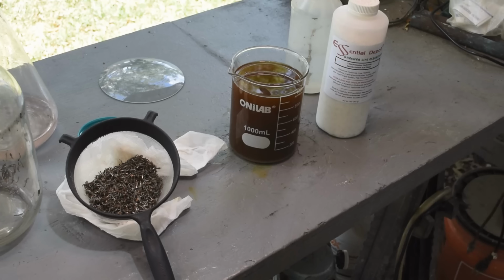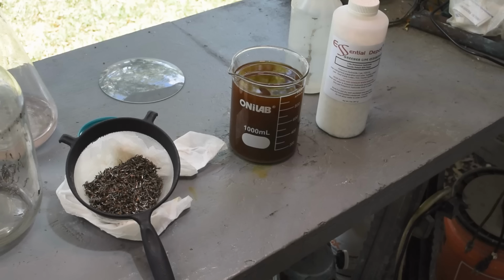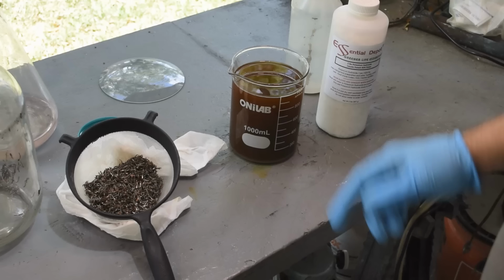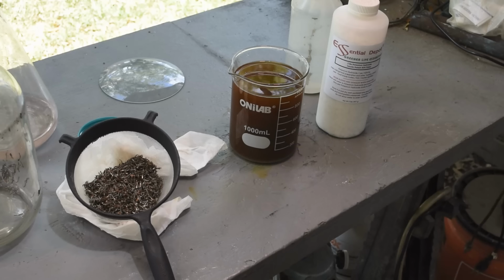To do that, I need to precipitate all of the metal hydroxides out of solution here. Right now they're in the form of iodides, iodates, and iodine complexes. They're held in solution except for this white stuff that's come out, which is probably some tin compound. Tin is always the enemy. But I've got some potassium hydroxide here. We're going to use this to raise the pH back up about where it was before we regenerated the leach. And then everything in solution should just crash right out.